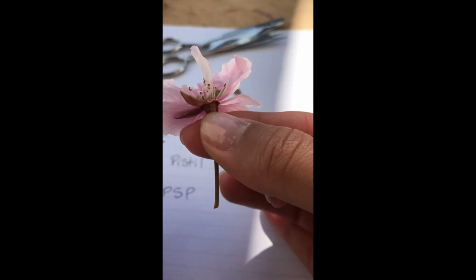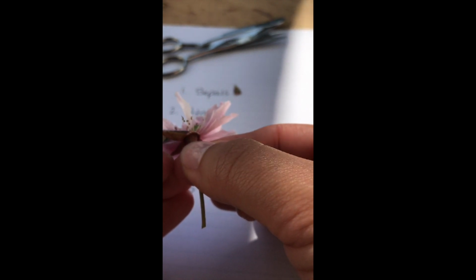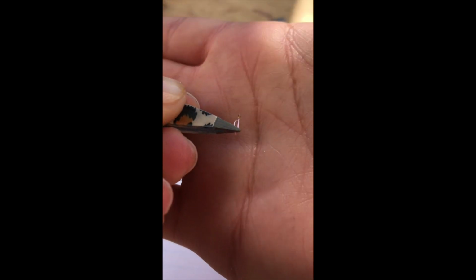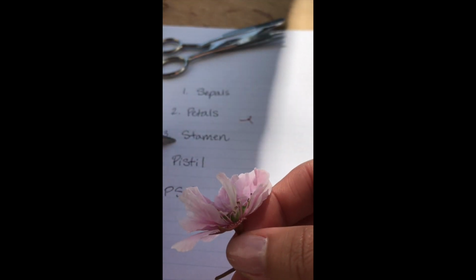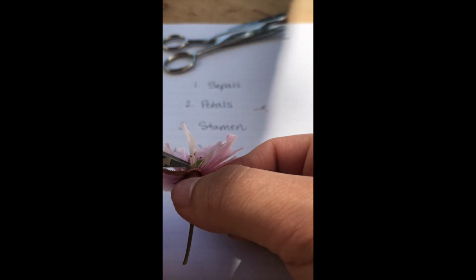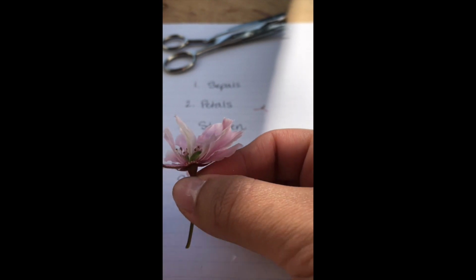So these little stringy parts that you can see in the flower are the stamens, and if I grab one with my tweezers and gently pull it off, you'll see that they come right off, and let me see if they'll show up. So we've gotten through 3 levels so far in this flower. Our last level is the pistil. So now that we've seen all of these stamen, I'm going to go ahead and pull them to the side.